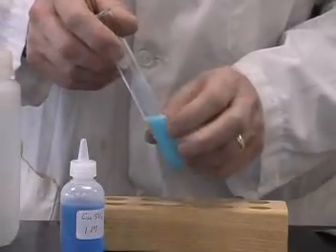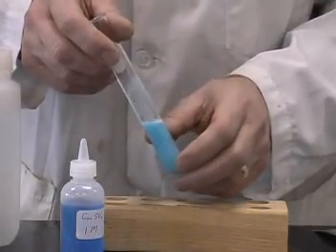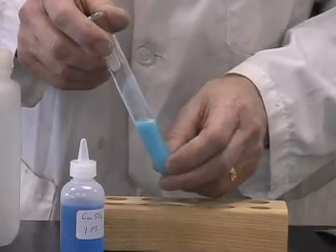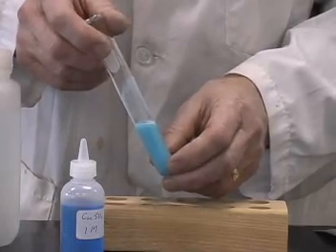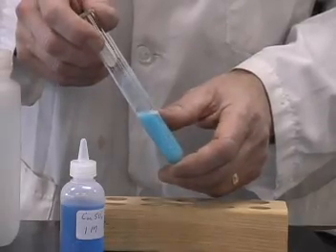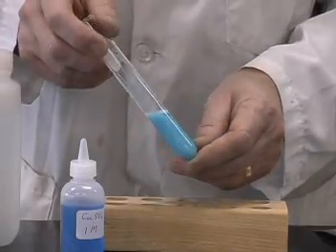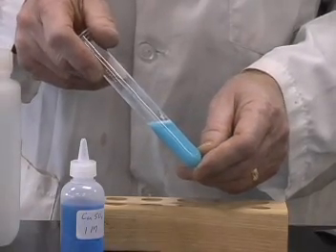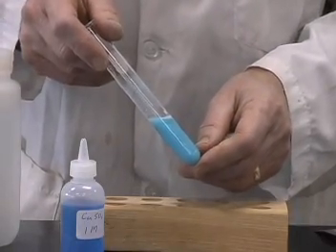The dissolving of the sodium carbonate, what I did initially, is an example of a physical change as the sodium carbonate dissolves. Adding the copper sulfate to the solution forms this blue precipitate of copper carbonate.